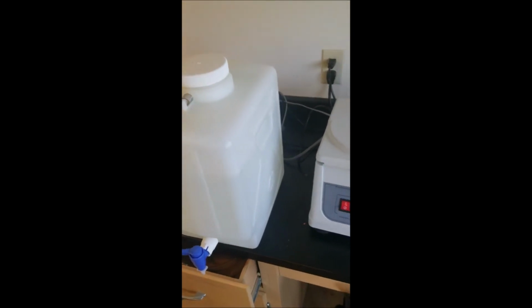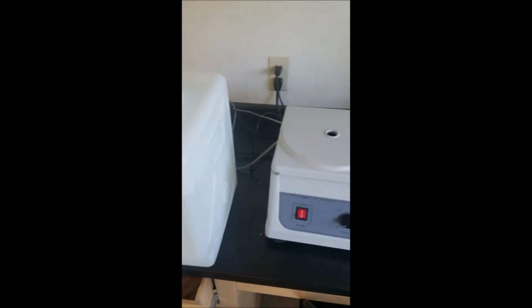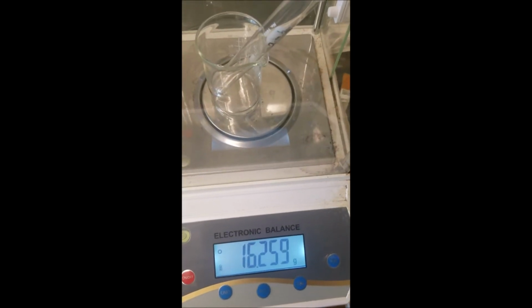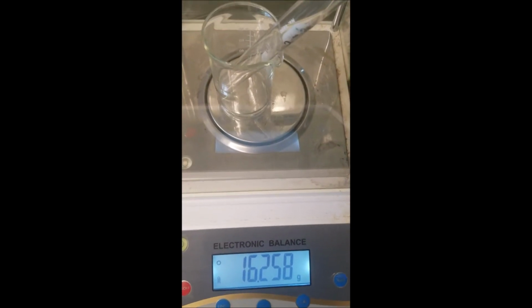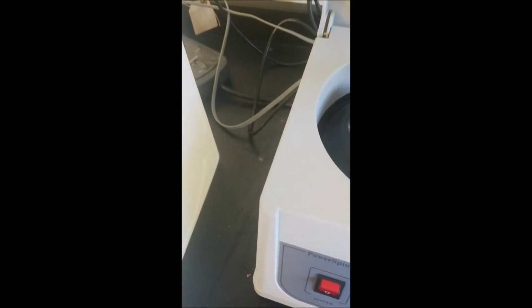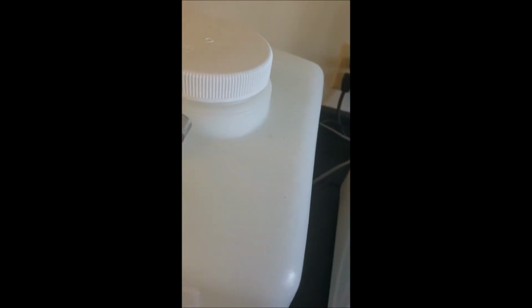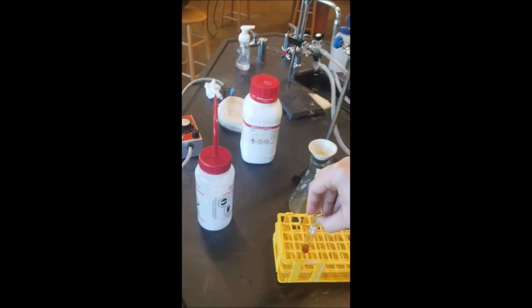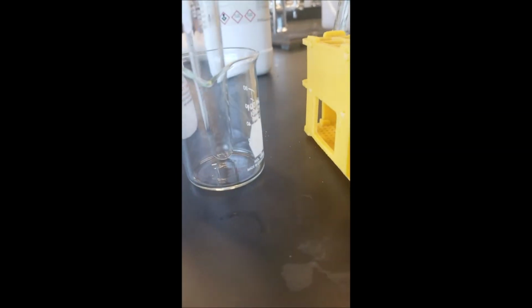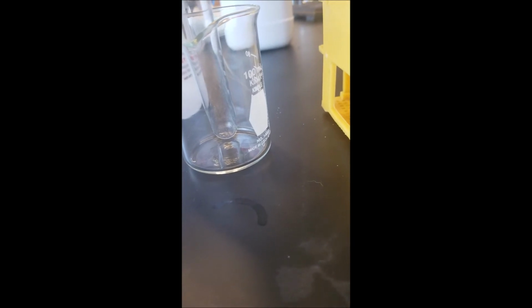In the meantime, I'm going to weigh out a new test tube for my sample. So I'm clean. I'm trying to get the weight of the test tube. I'm going to put in 16.258. Now I'm extracting my tube from the centrifuge. Get my tube. Maybe there's no solid in here, but we'll go ahead and just making 100% sure.